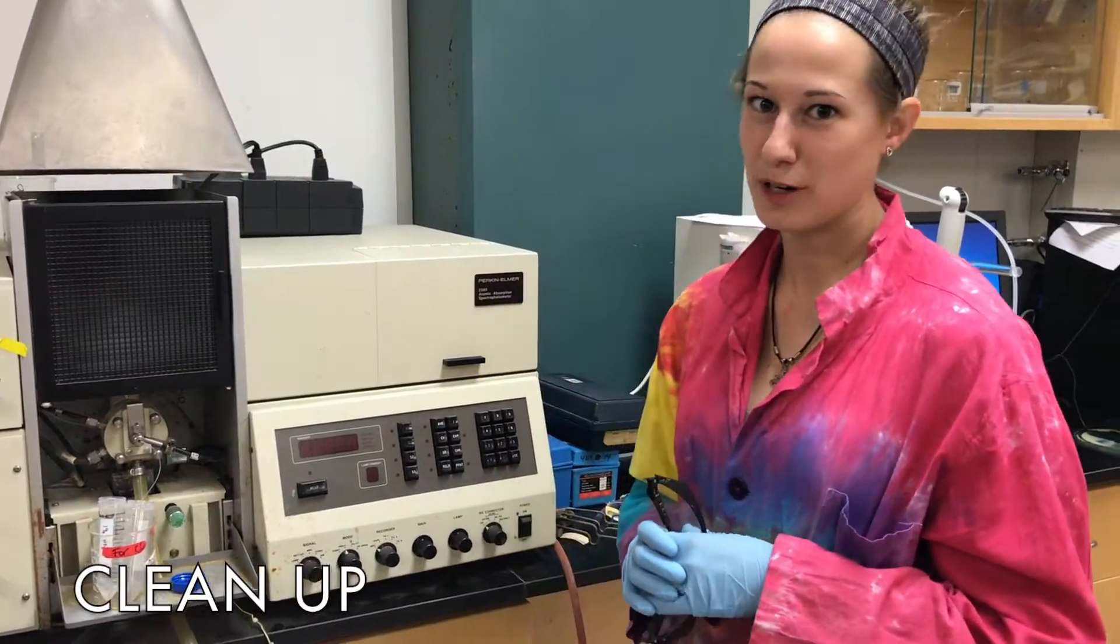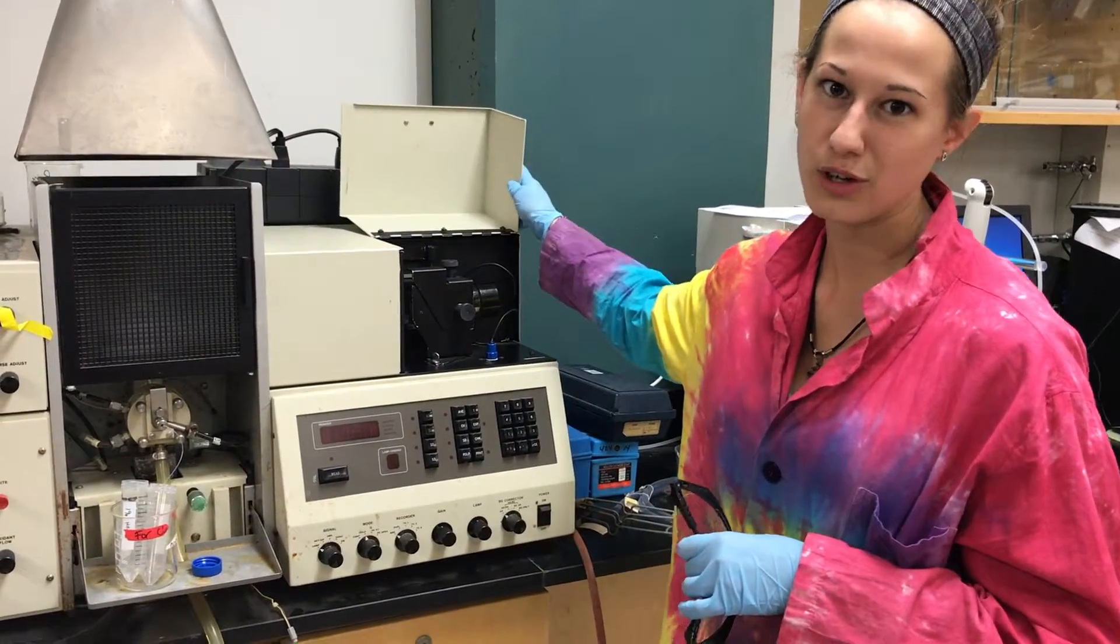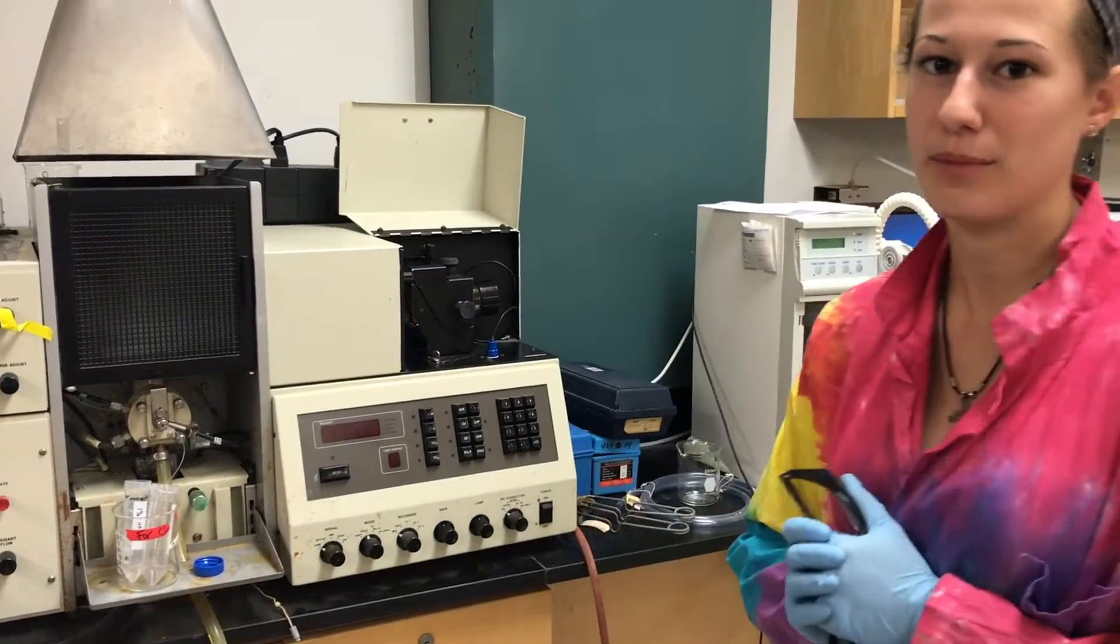When you're finished with your experiment, be sure to remove the lamp cautiously, put it back where you got it, and clean out your sample containers, and put all equipment back where you found it.